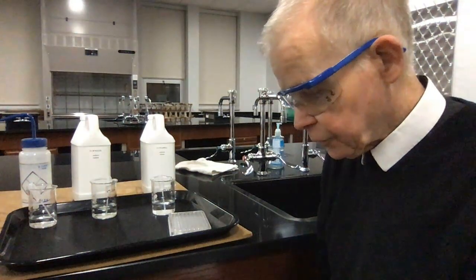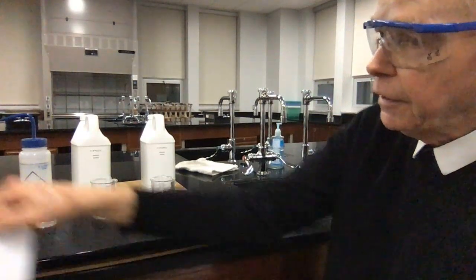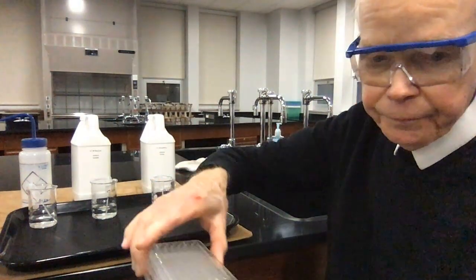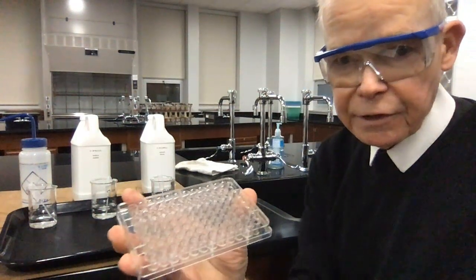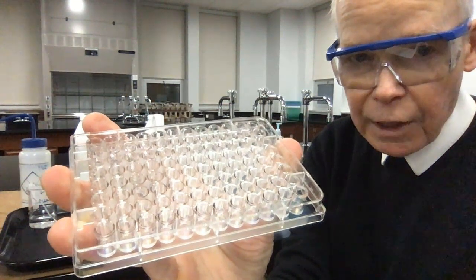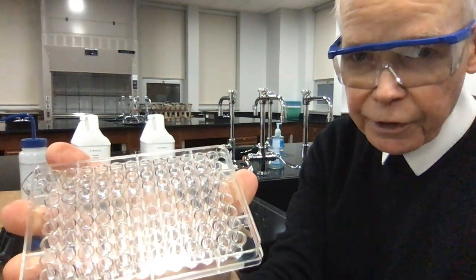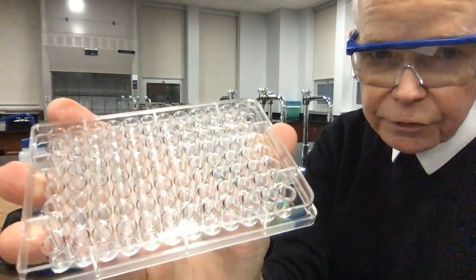The piece of equipment that is going to be critical to this is a set of very tiny test tubes, as you've been accustomed to using, in what we call a well plate. You're familiar with this. And this one has 96 wells in it. Each of them is the same size, and I already have some solutions in them. If I tilt them, chances are they'll stay in, but I just don't want to flip it vertically. But it gives you a sense of what we're looking at.